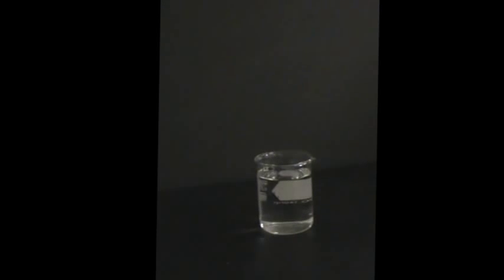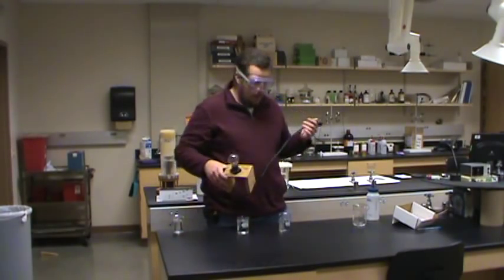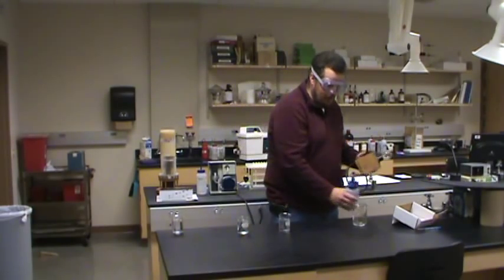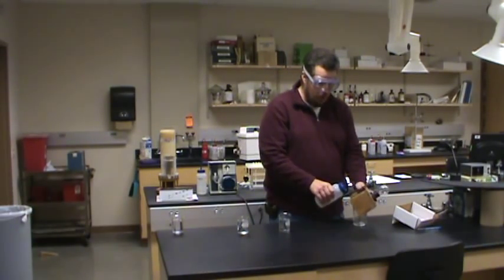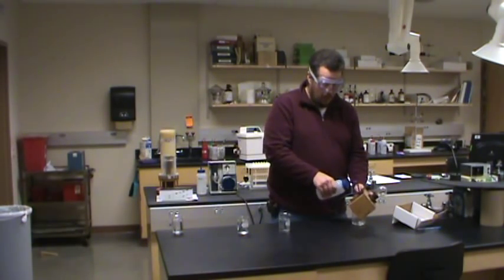Here's our salted water. When we dip the probe in — all kinds of light! There's plenty of conduction going on in that solution. The salt solution conducted a lot more electricity because there are ions present; there are things available in that solution that allow electricity to pass through it.